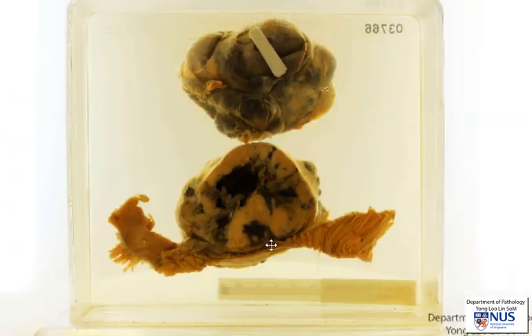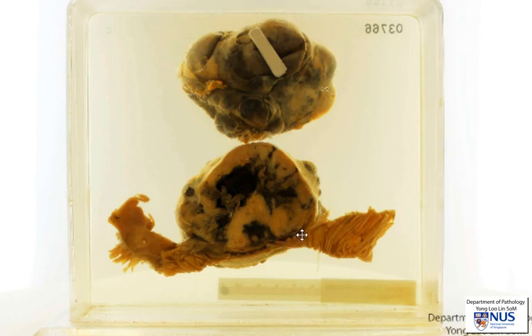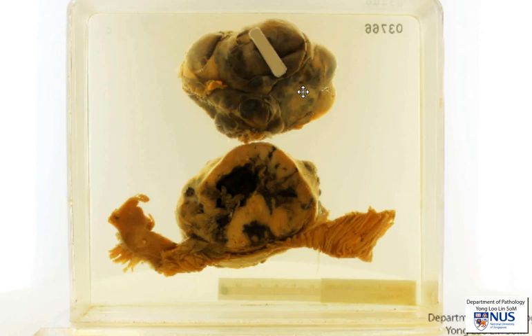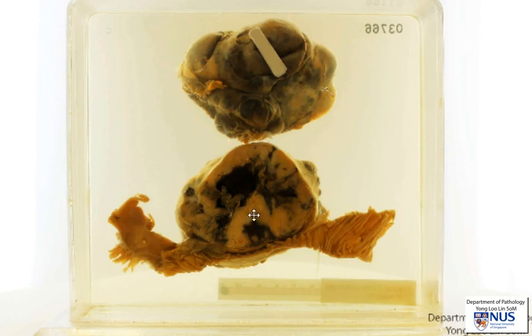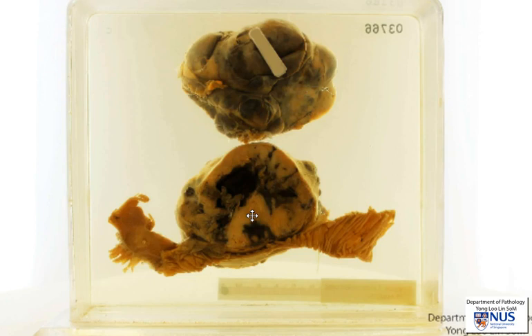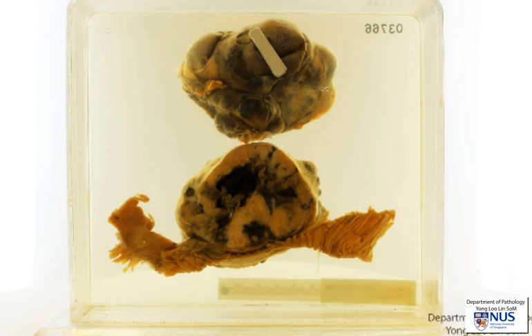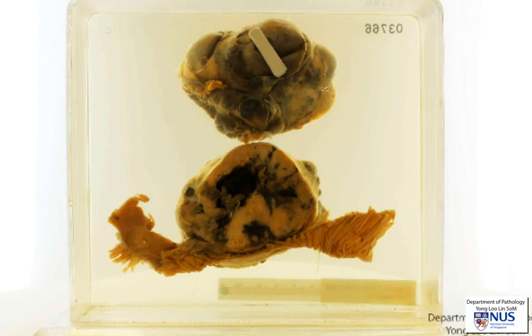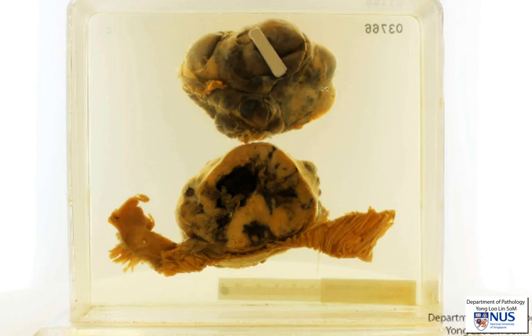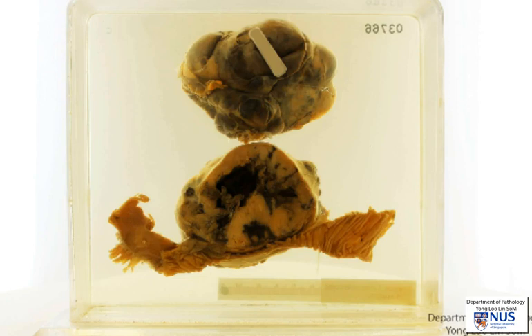In summary, there is a mural nodule within the wall of the small bowel. It is relatively well circumscribed, fairly lobulated, and has a tan cut surface with patchy areas of hemorrhage, representing a mesenchymal tumour. In the context of the small bowel, or if this was in the stomach, the most likely mesenchymal tumour would be the GIST, or gastrointestinal stromal tumour. Thank you.